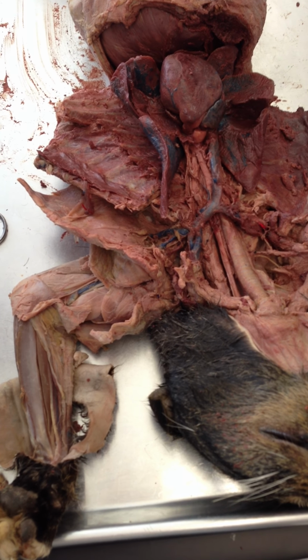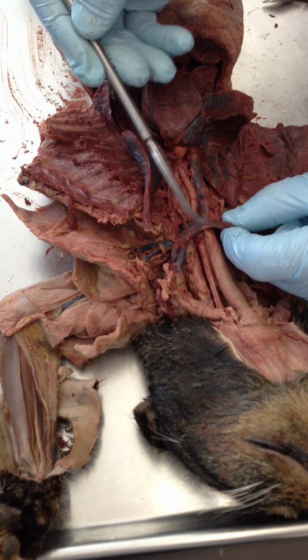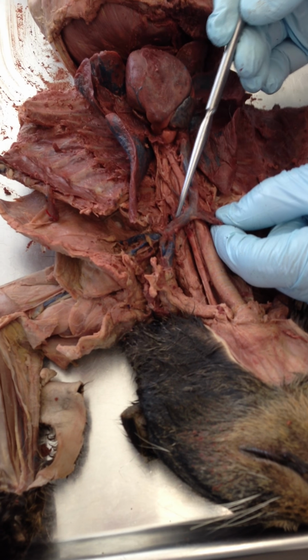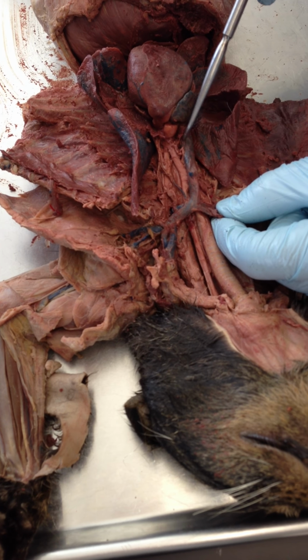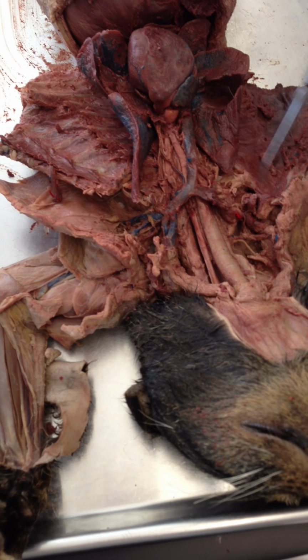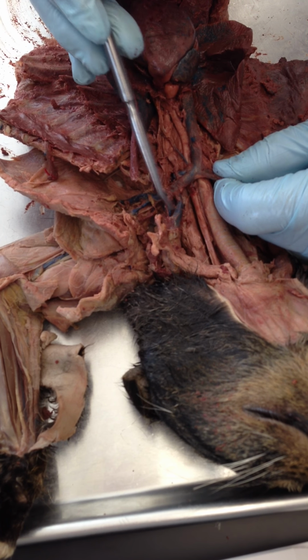Pulmonary artery. Okay. Now, you need to know the branches that lead into the superior vena cava. So, from the left side, we have the left brachiocephalic. From the right side, we have the right brachiocephalic. So these two branches add their blood together, and that drains down the superior vena cava. Now, the right side here looks like it was destroyed, so we can only really look at branches over on the left side here. So what are the branches here?